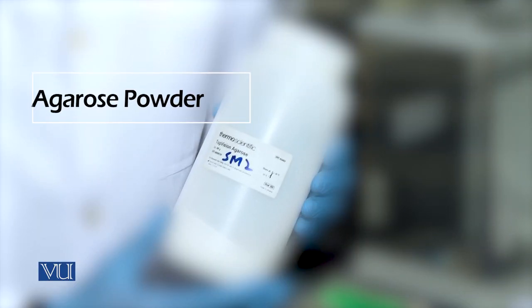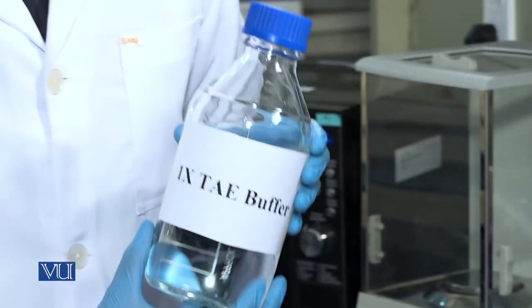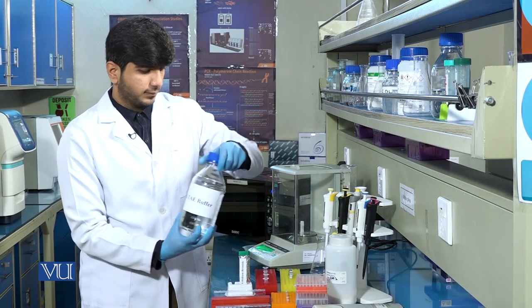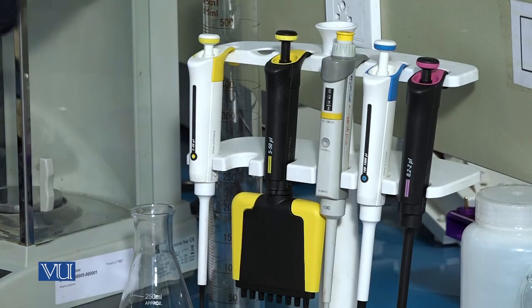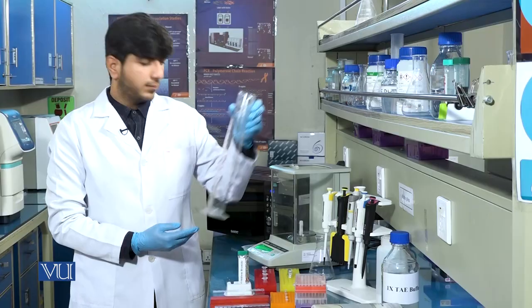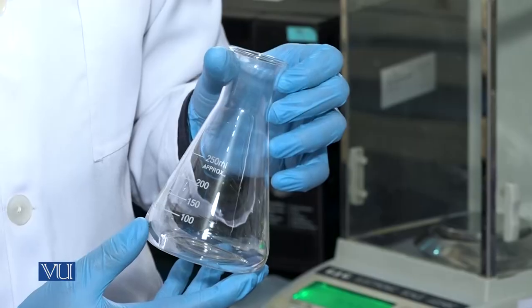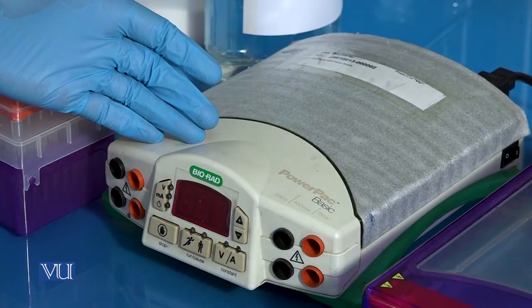Agarose powder, 1x TAE buffer, pipettes, measuring cylinder, conical flask, gel caster, gel tank, and electric supply.